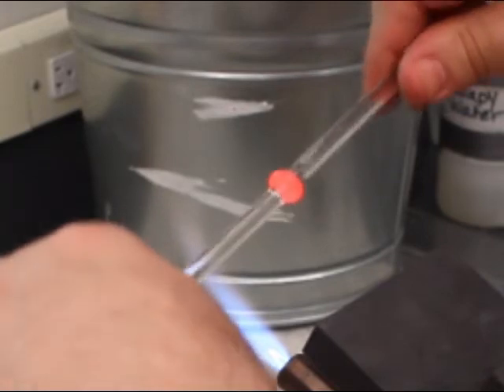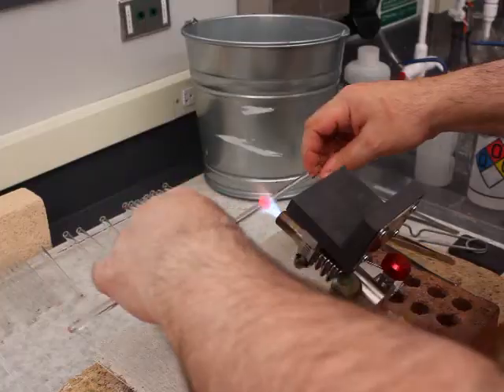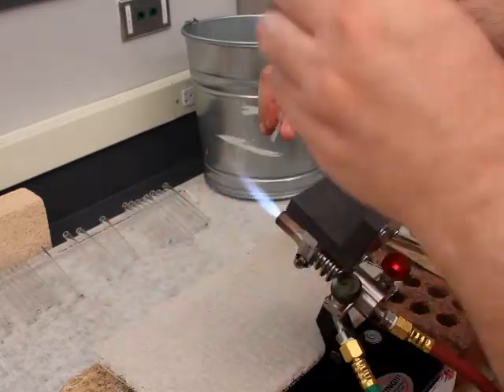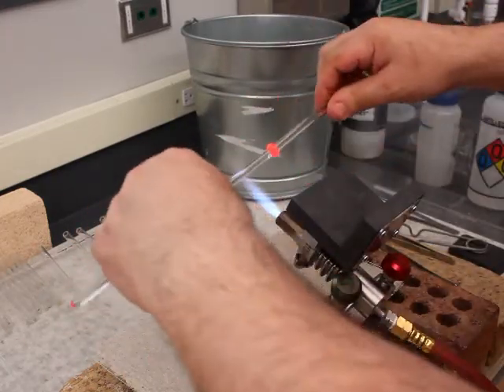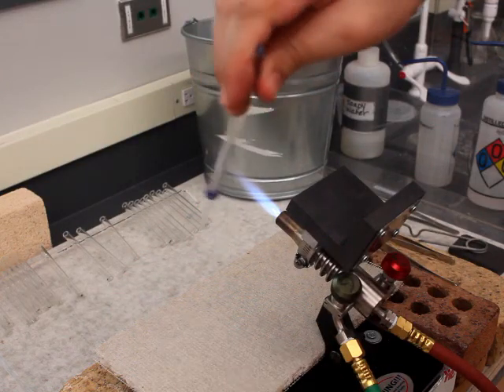I'll speed through this in a second, where I use the Marver a little bit to help round out the edges, but this is a very good practice exercise of making a Maria, and if you can make one where it's a distinctive color, that should highlight both your successes and your failures.